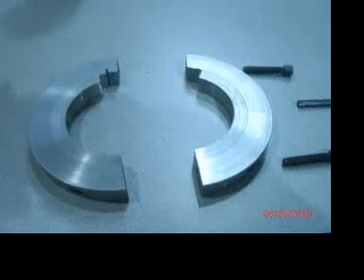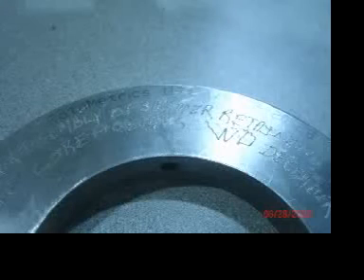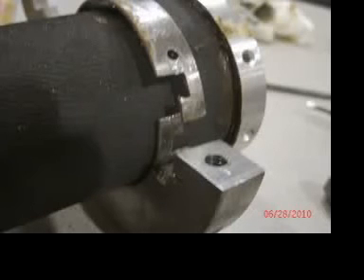This is a tool that I created specifically for putting the rings on. It's made out of a recycled gear, in this case 117 tooth 1/8 inch CP, and I have access to a lathe, so I made it real easy. If you're not quite so able, what you might be able to do is to get a large shaft collar of that size. But it's tricky. It's so tricky.